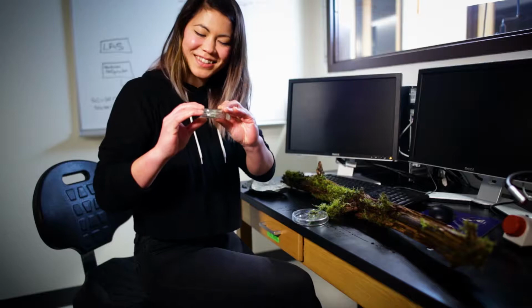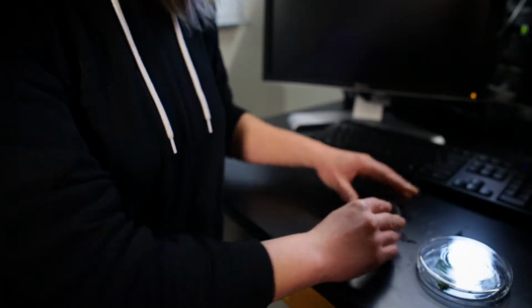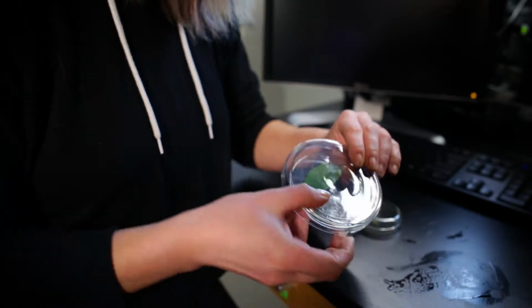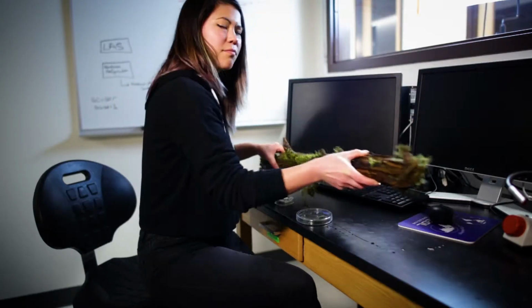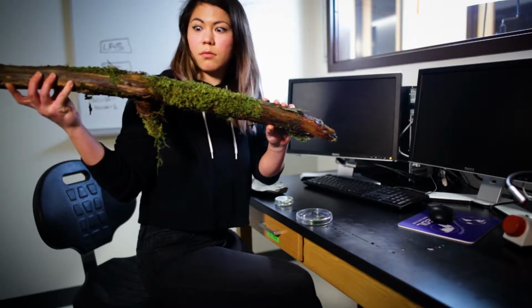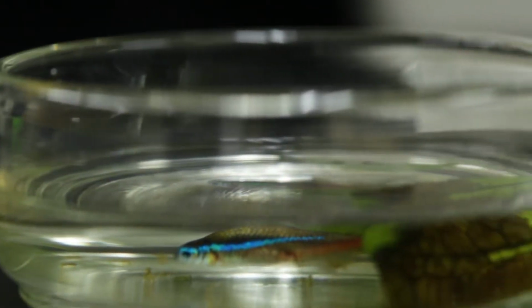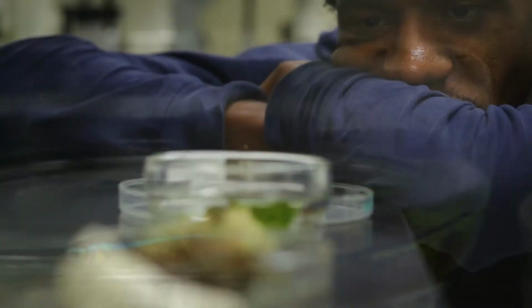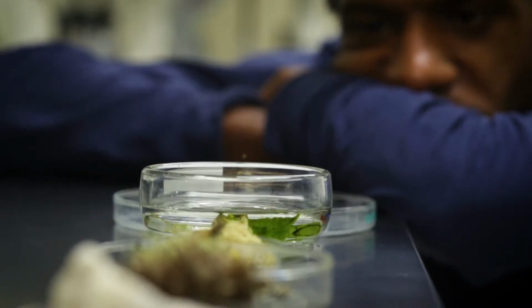Be sure that you've brought your samples to work with. Samples that are appropriate are objects larger or thicker than a compound microscope can accommodate, but small enough to fit on the stage and under the objective lens. Liquid samples should be in a clear container, like a petri or specimen dish. Living specimens should be in a clear container from which they cannot escape.